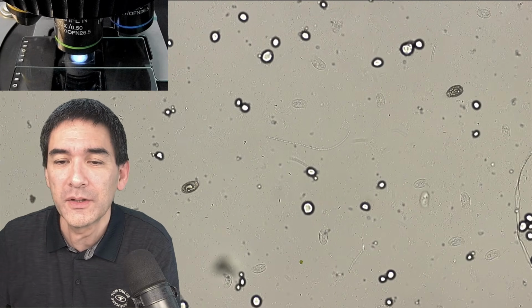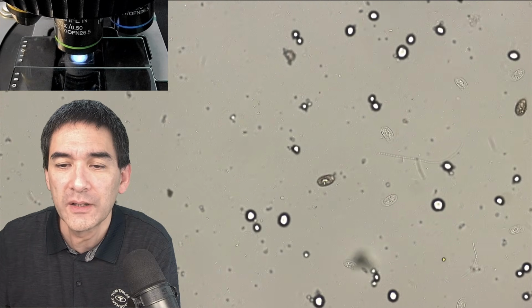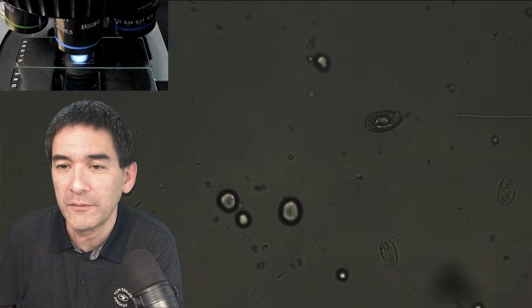But let's move up a little bit. Sometimes it's good if you're actually finding one that does not move quite as much. And then you just zoom in a little bit. Zoom in, well, you go up with the magnification, of course.